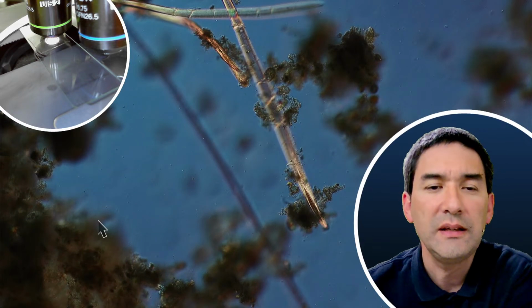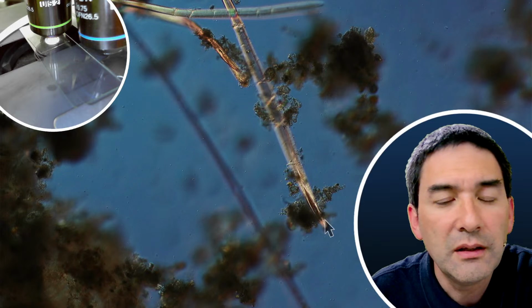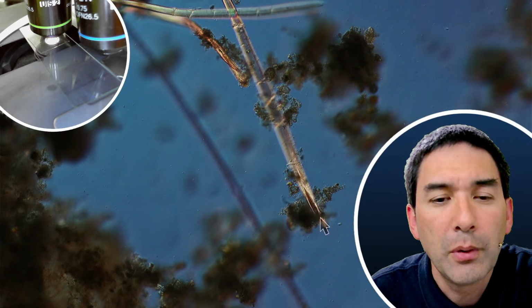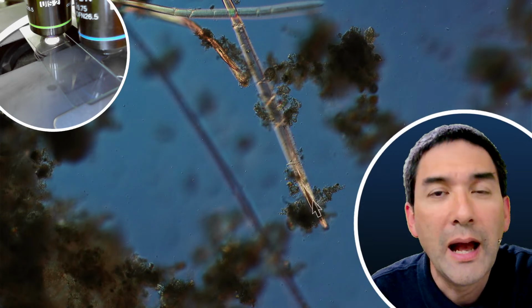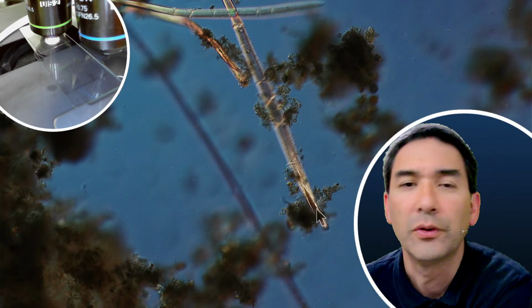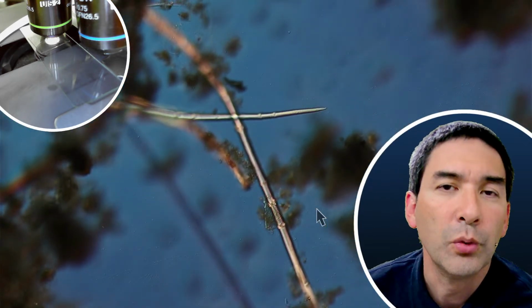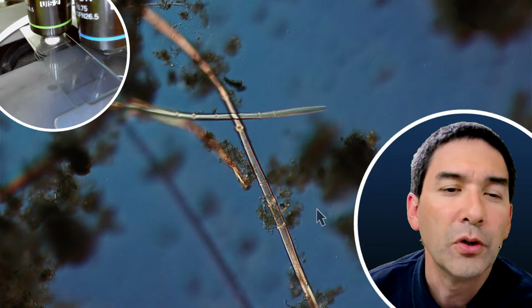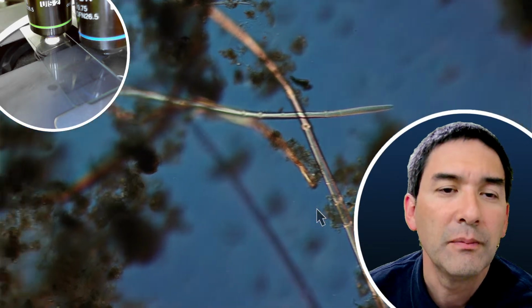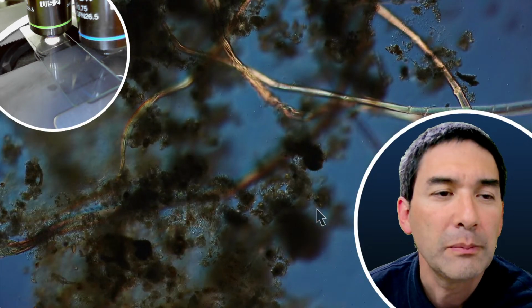It's not so easily visible here, but if you look at the end here, you see that the hair has a little bit of a different color, and I think this might be part of the hair root. So animals were basically in the area, so it shouldn't be surprising that you can also find some animal fur here as well. Sometimes if you magnify a little bit more, you can see that the fur has a canal, is hollow in the middle, so that's also an indicator that we're looking at hair and not at plant material.